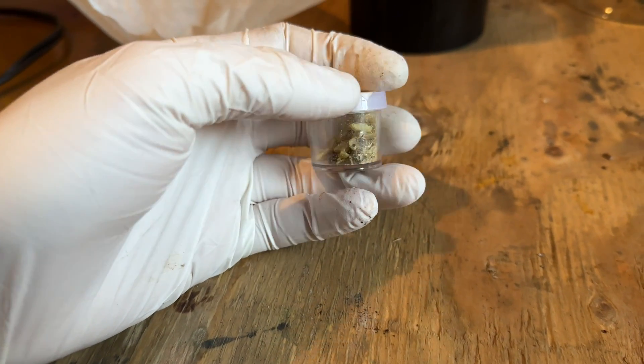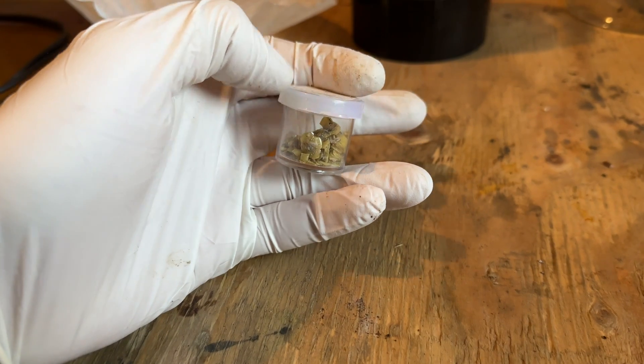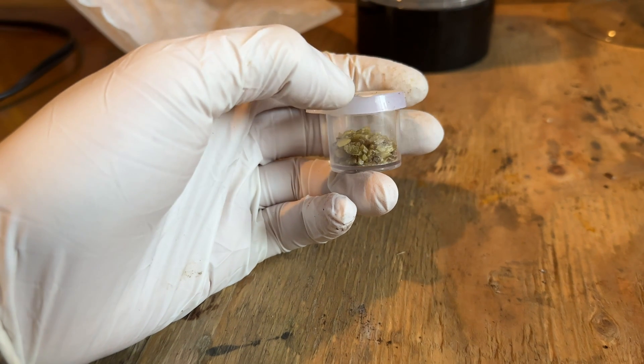In total, 5 grams of sulfur was obtained. Although this is a fun way to extract sulfur, the easiest way to obtain sulfur is by purifying it from gardening sulfur. I hope you guys enjoyed, and I'll see you in a future project. Bye!